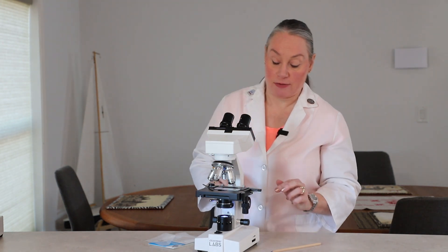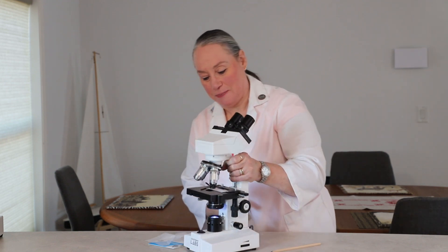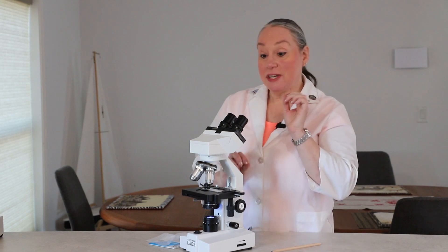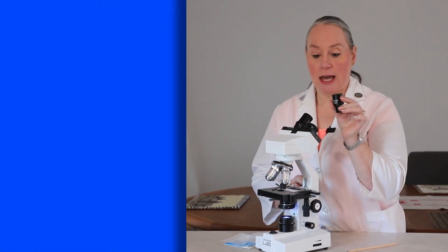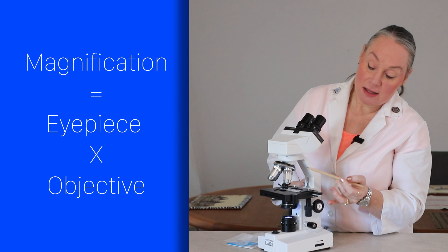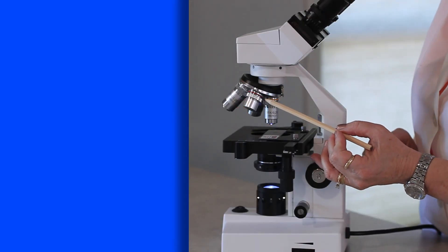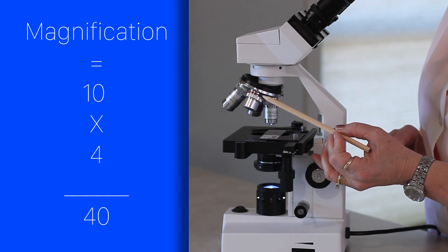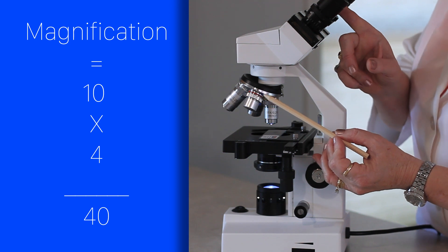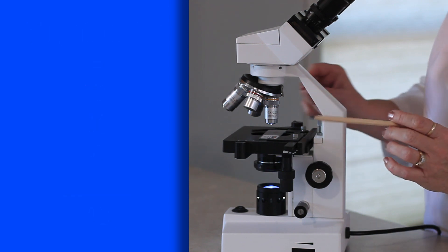Let's talk about what you're going to see, how many times magnification we have, and how to calculate magnification. Magnification is calculated by the magnification in the eyepiece times the magnification in the objective. This is our low power objective — it is standard in science with a red ring. It is 4 times magnification, and the eyepiece is 10 times, so 10 times 4 is 40 times magnification. When I begin, I'm going to begin on 40 times magnification.